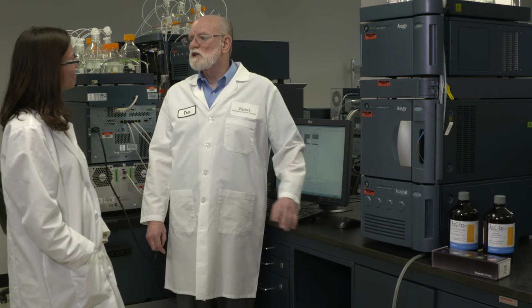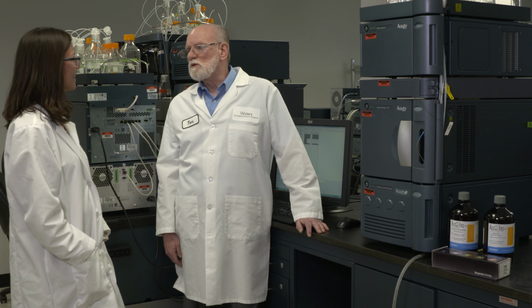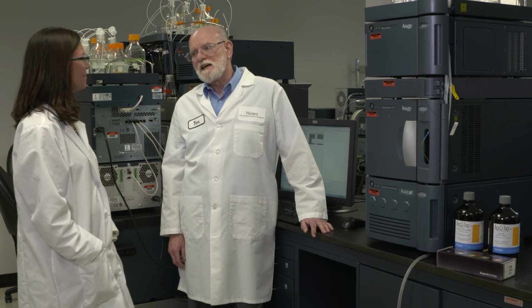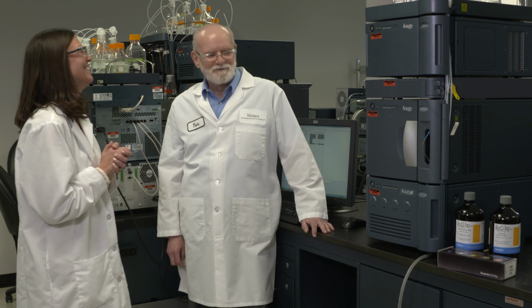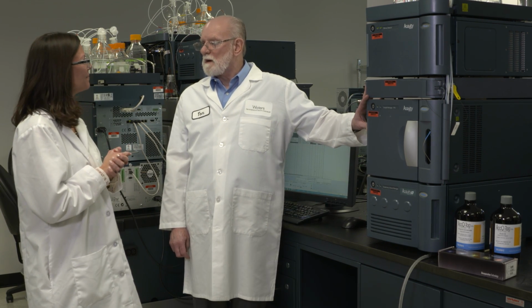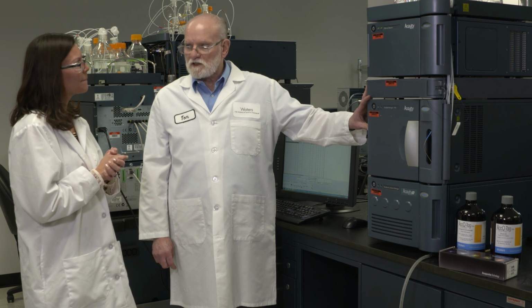So, let's go ahead and run your samples now. This would be a part that you like because once the derivatization is done, you can't contaminate the samples anymore. This is the system that we use. It's an H-class bio system. We can do it on any H-class system.